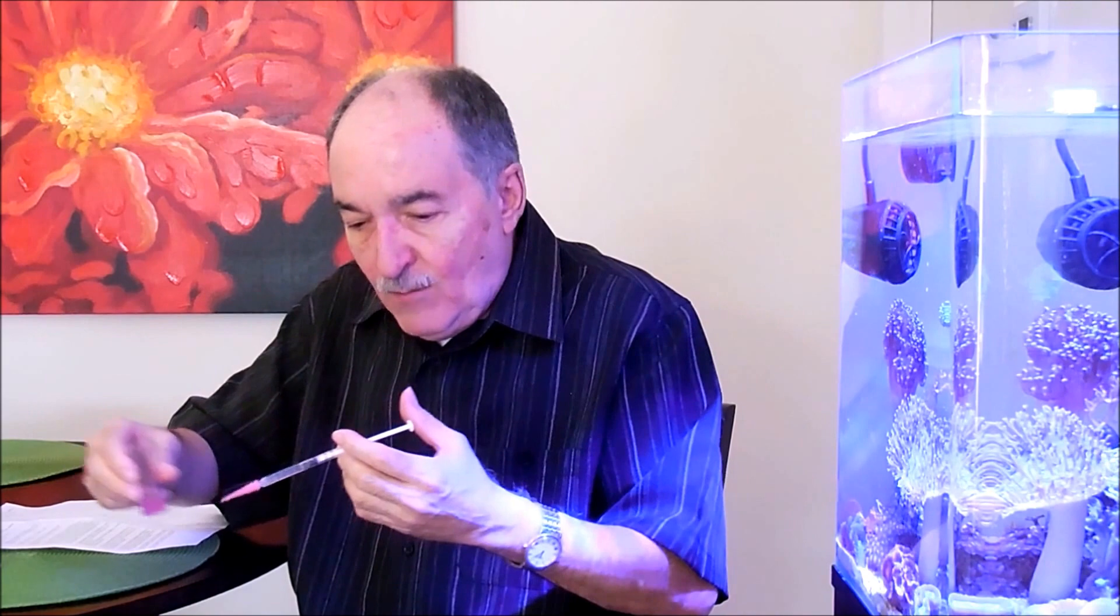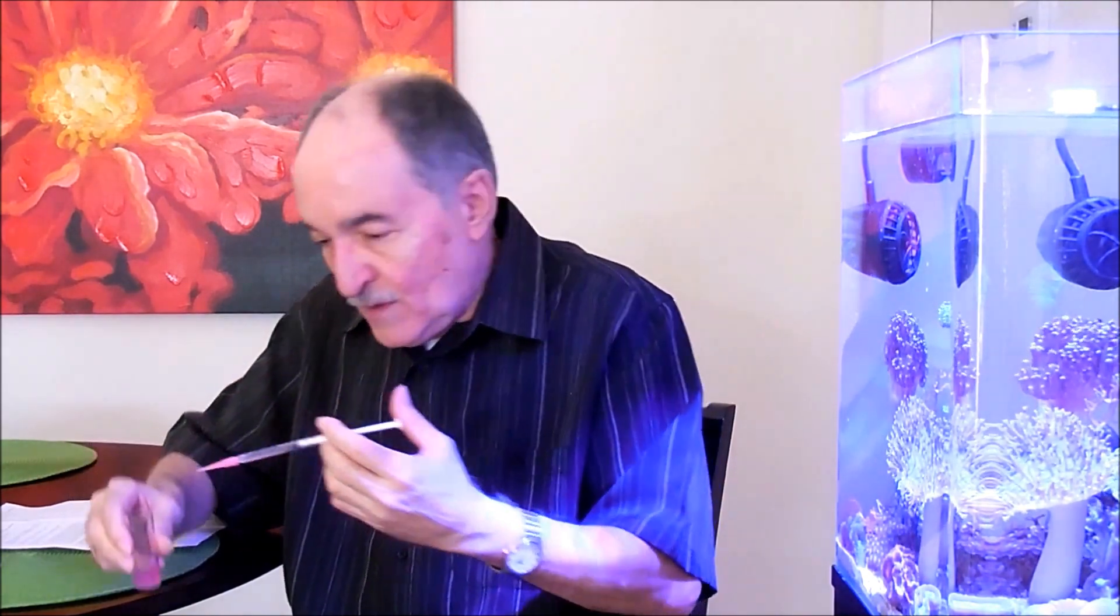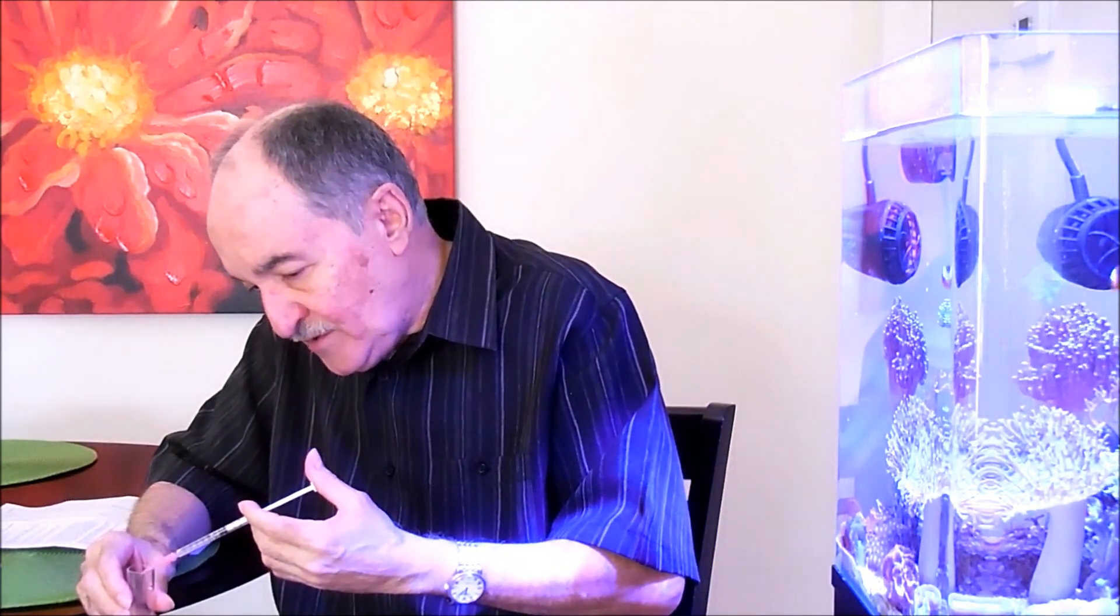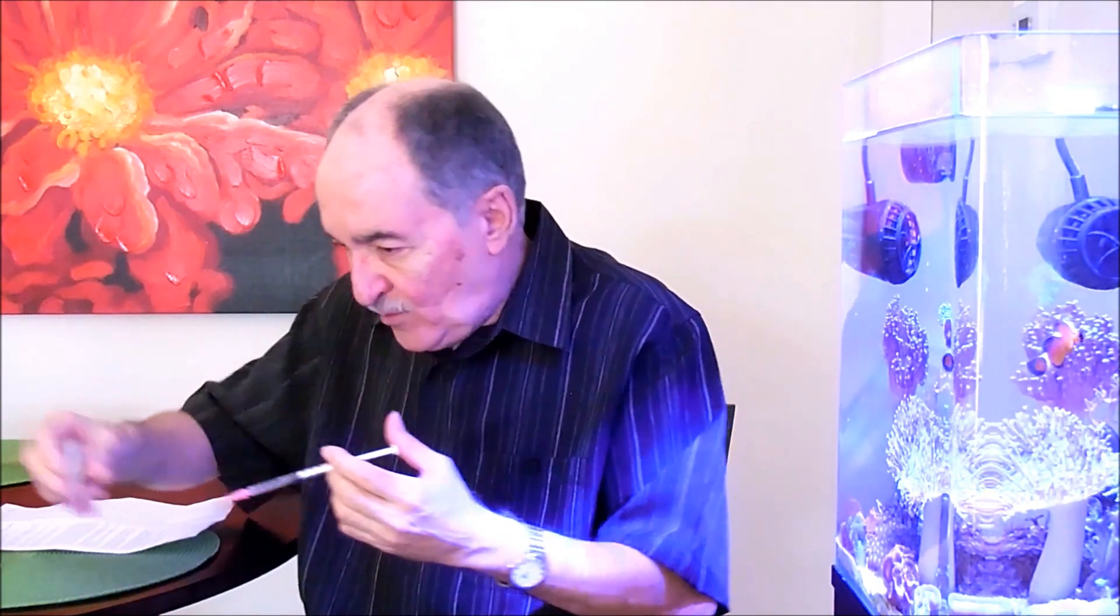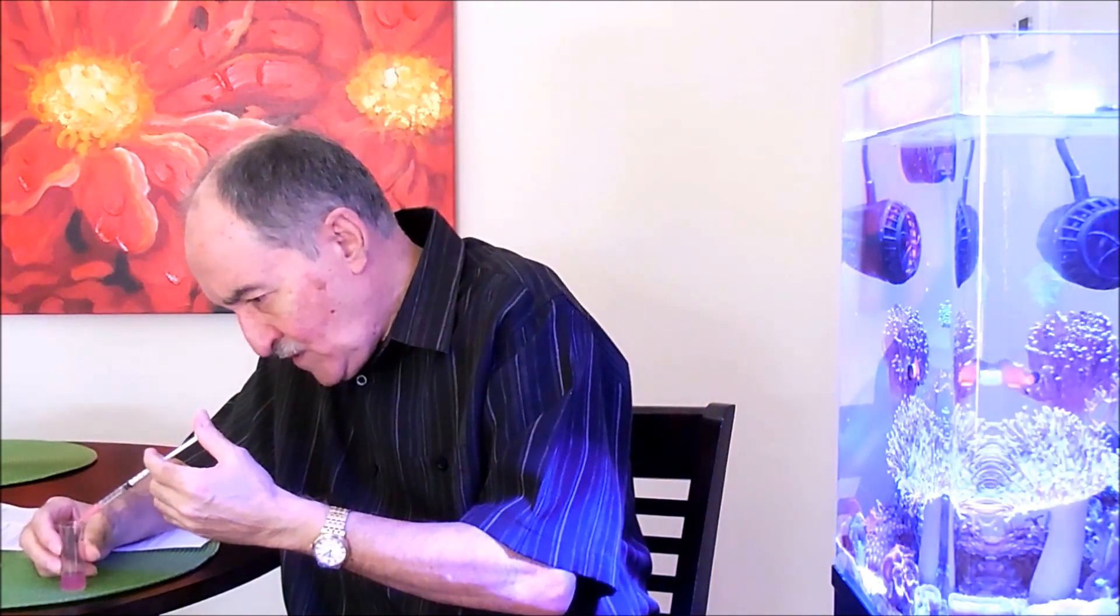I'm not going drop by drop because I more or less know, and you would get to know that as you go along. More or less like half of the syringe or a little more is when you really start to get the color change. Keep swirling, swirling.